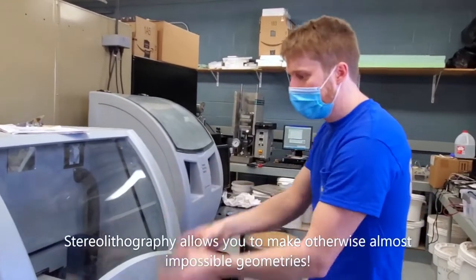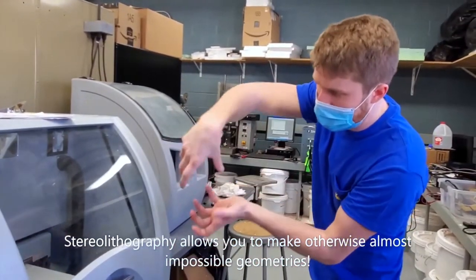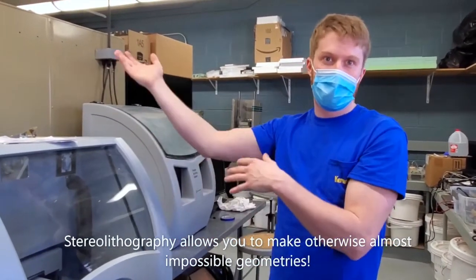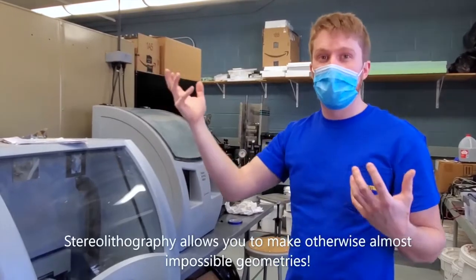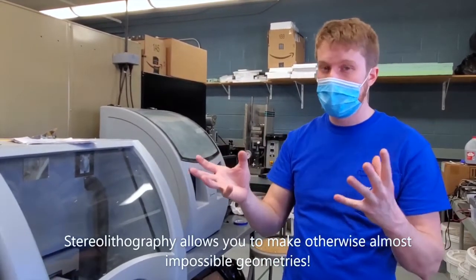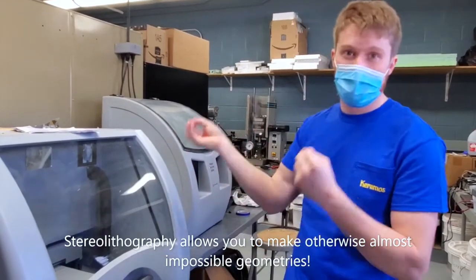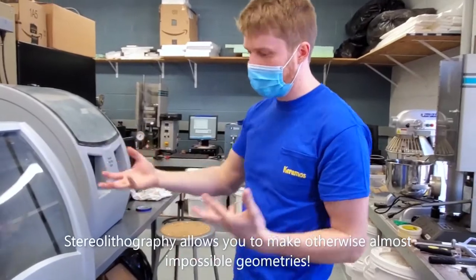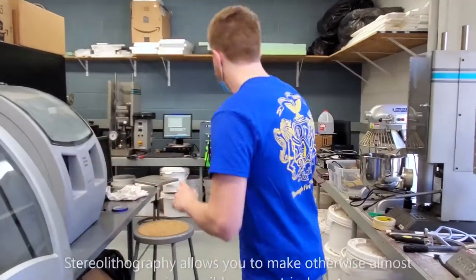So when you're done, you lift out your sample, shake out all the stuff that hasn't been glued together, and then you would put it in a sintering oven like we saw in the thermal labs. And in the sintering oven you would actually pyrolyze or burn out all of the polymer binder that's in there, and then sinter the ceramic particles together, which will give you something that's actually what we would think of as a hard finished ceramic.